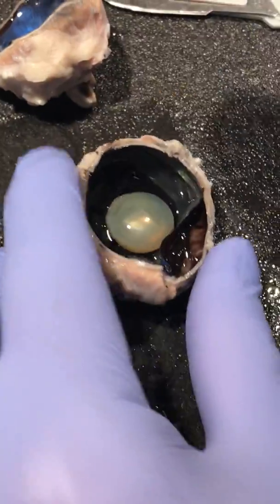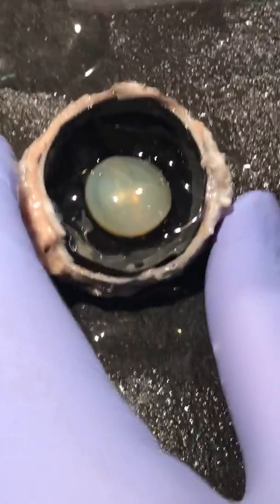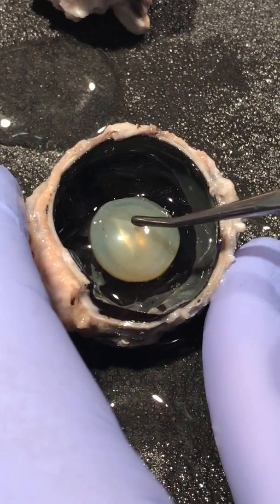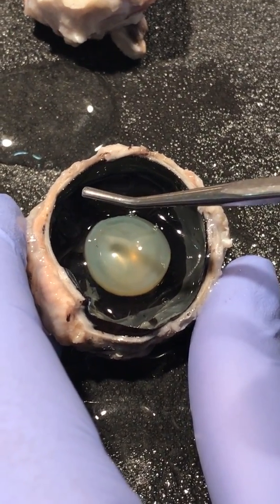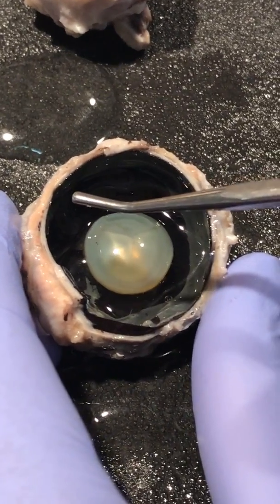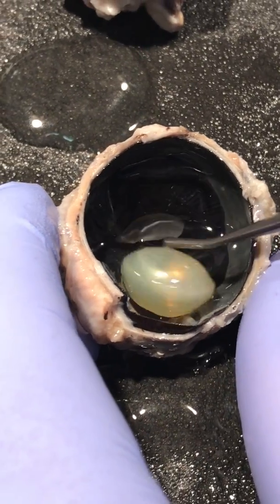I don't want to destroy the eye. There you go. So here inside, in the anterior part of the eye, we can find the lens. The lens is responsible for allowing the eye to focus on small details like words in a book. The lens is in a constant state of adjustment as it becomes thinner or thicker to accommodate the detail input it receives.